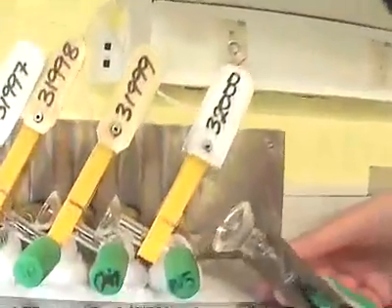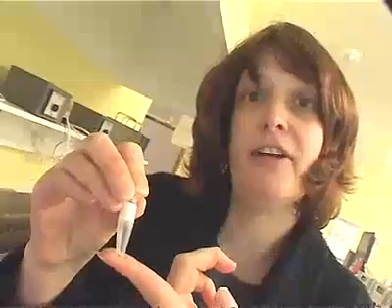CO2 plus H2 heated at 700 degrees will form graphite and water. The reaction vessel is put into the oven at 700 degrees for about 5 hours. And after that, when we weigh it back, we get a small amount of graphite, just about the size of a few flakes of pepper, and that's sent down to the accelerator for dating.